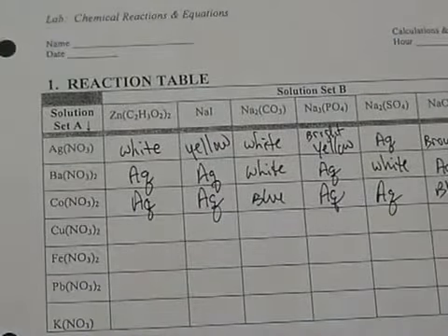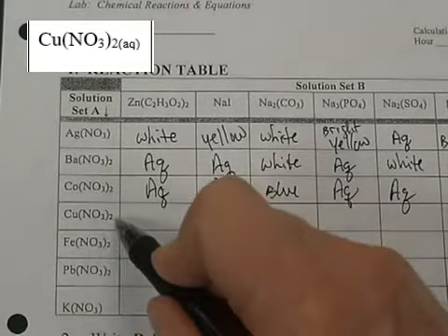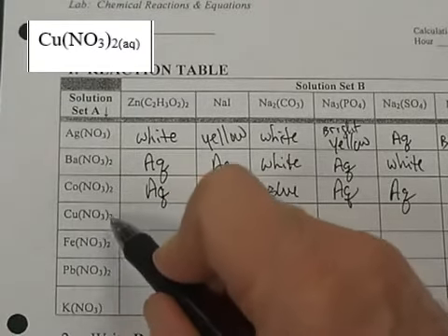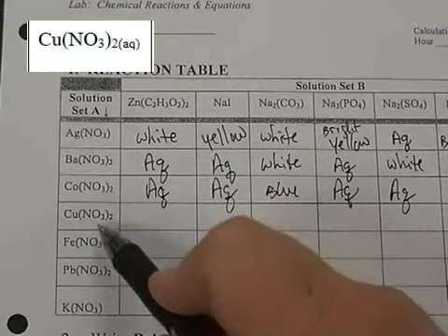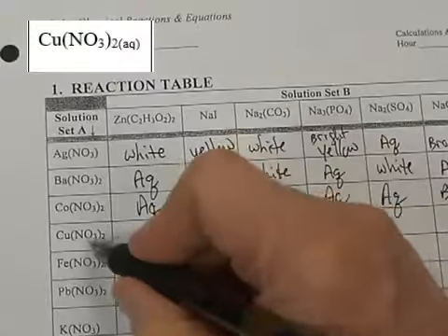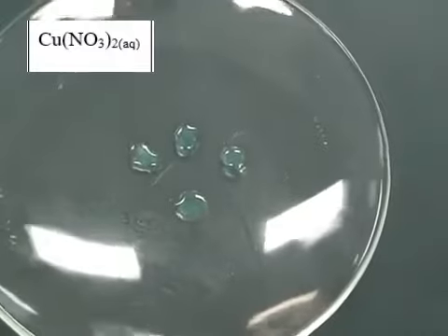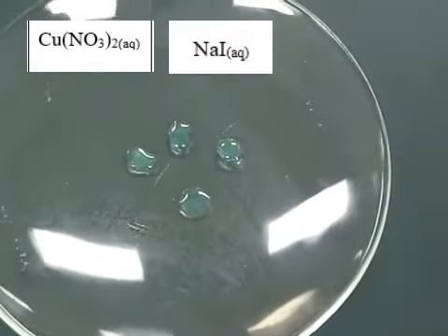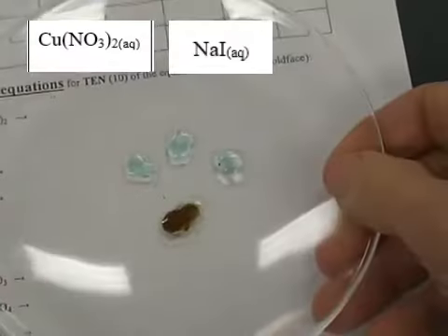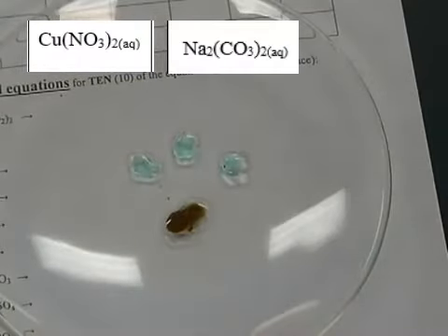All right, the next chemical we're going to use is copper nitrate, Cu(NO3)2. That means it's copper plus 2 nitrate, so we'd call it copper 2 nitrate. And like a lot of these, the zinc acetate does nothing with this. Copper 2 nitrate with zinc acetate, aqueous. It's a slightly blue color, so if I bring out sodium iodide, a brown, so that'll go in our chart as brown. We'll do sodium carbonate.